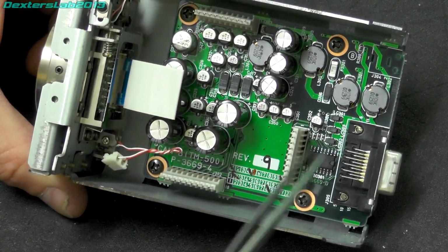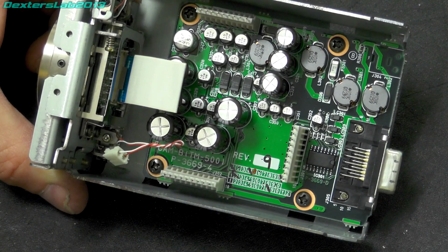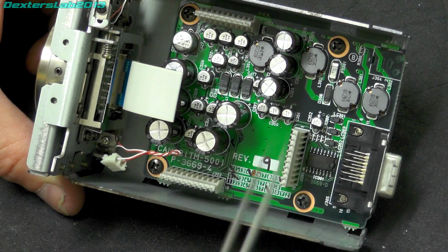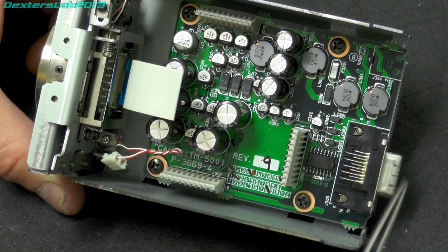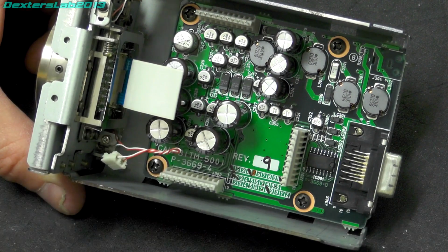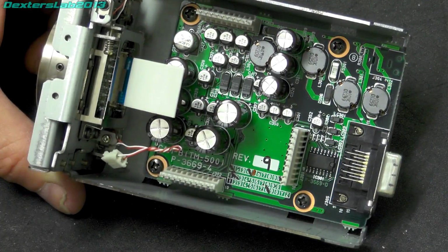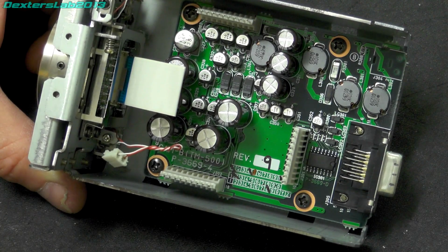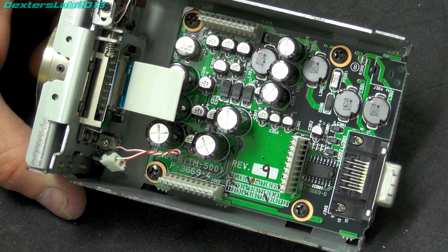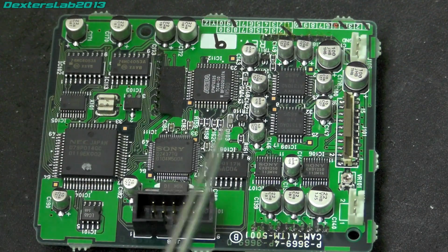Incidentally, I have no idea what the interface mechanism is on this cable. Obviously, you're going to be needing power, ground. There's going to be some kind of control signal, which is probably some serialized command thing. It might even be RS-232 that's just sent over the same cable. And then there's going to be some kind of image data, which is then transferred to the card. I would imagine, given that there's not a huge amount on here, that it's going to be pretty basic raw data. That is probably also parallel, I would guess. And interestingly, the specification doesn't detail how many bits of color value we have, so I'm not sure whether it's 8-bit, 10-bit.